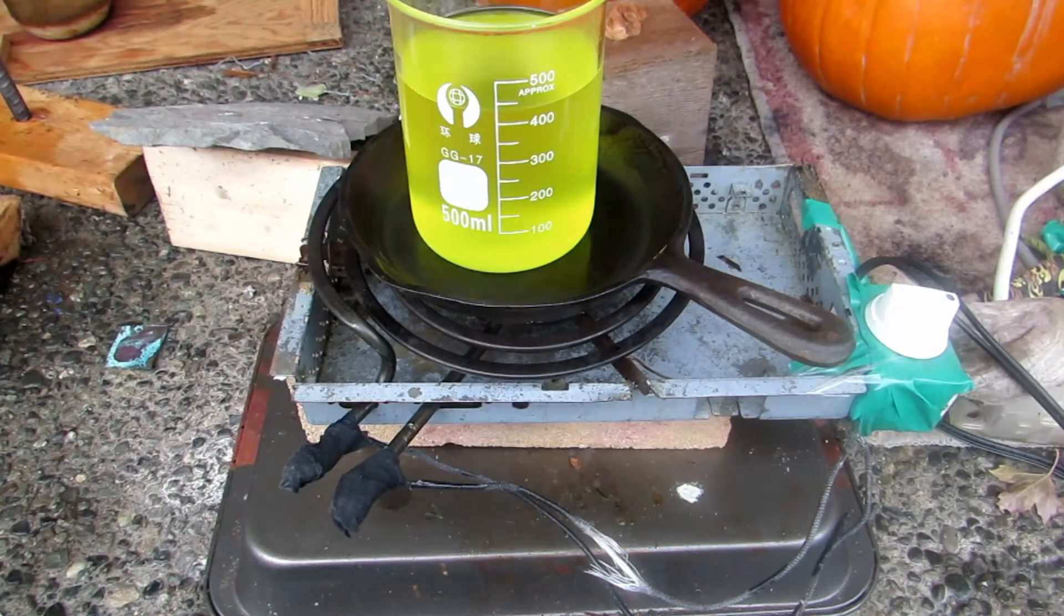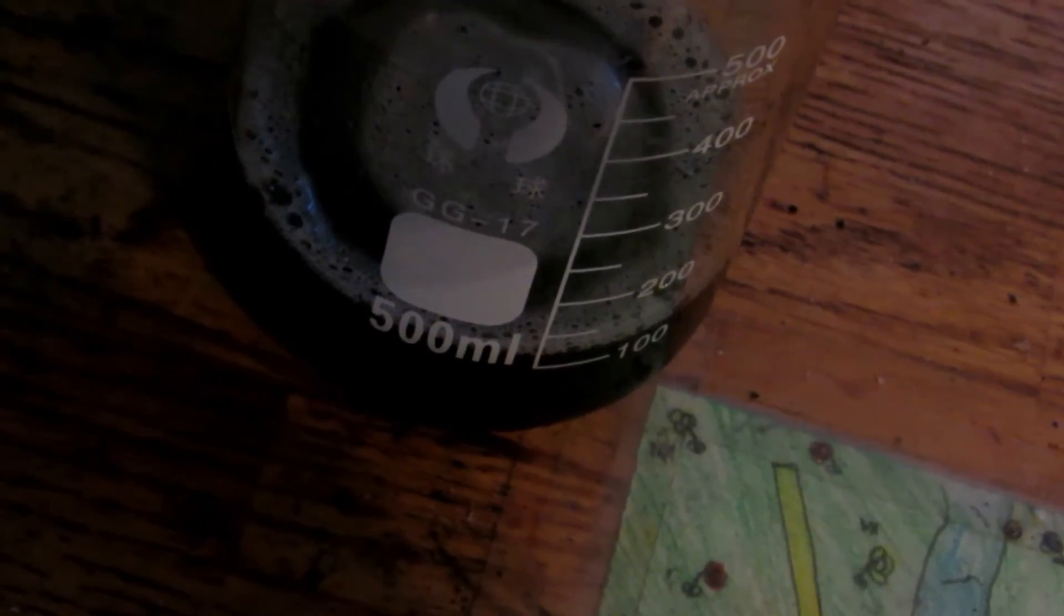Okay, so I boiled it down a bit too far. I boiled everything down but it got a bit too hot on the bottom and slightly charred the bottom of it. That might just be the color decomposing from the ammonium hydroxide, because ammonium chloride does not decompose till over 300 degrees Celsius. I just added 100 milliliters of water to redissolve as much as possible. Anything that's insoluble will then be filtered off. I'm going to go ahead and take this and filter it off. This will leave us with our solution without any solid impurities, and then we can do a recrystallization.